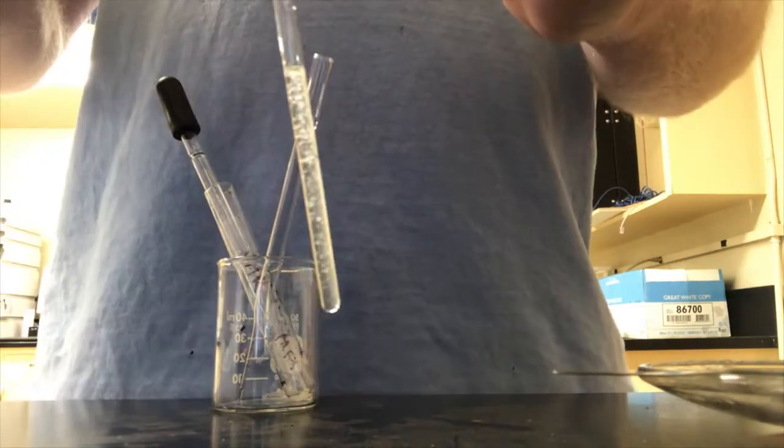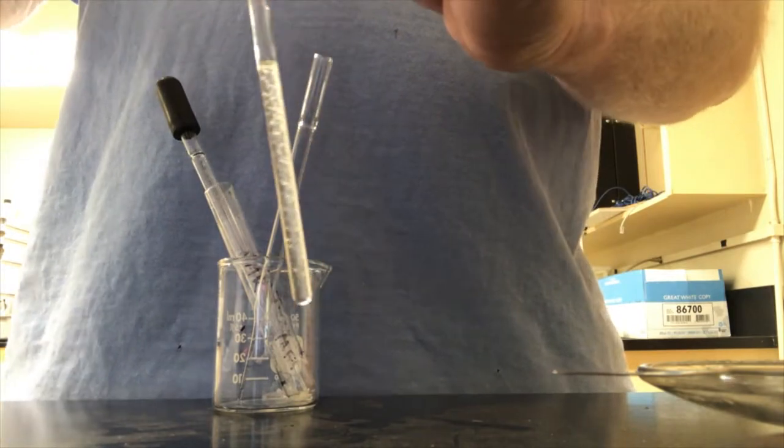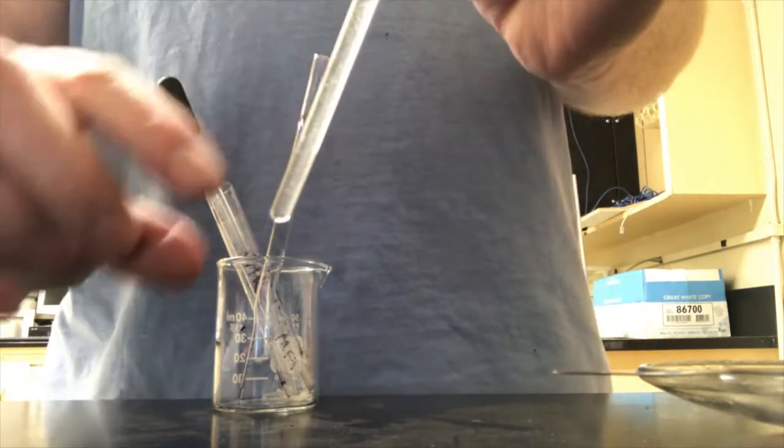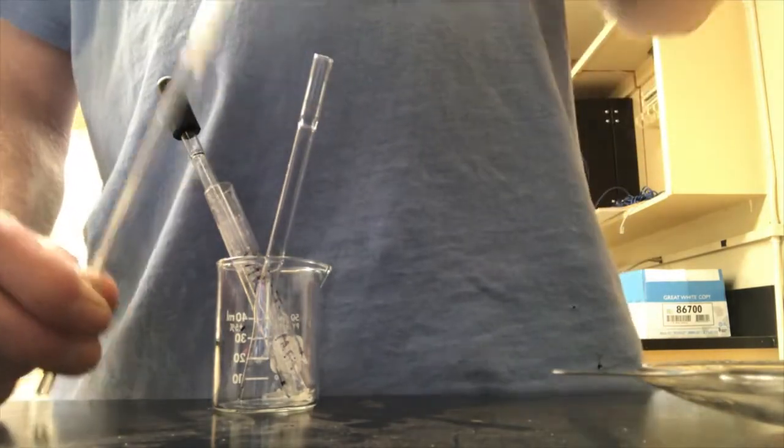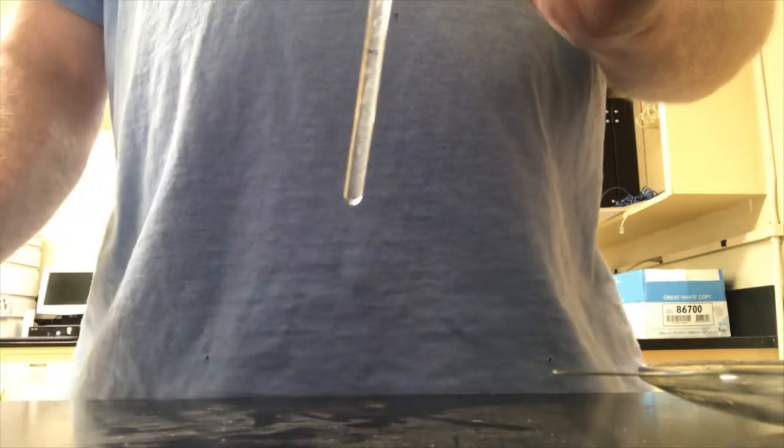And if I want to really go to the next level, I can heat this just very briefly with a blow dryer. But you have to be careful. If you heat it up too much, this cap will pop off on you. So you always got to wear your safety goggles and be careful with it. But I believe that this alone is going to be good enough. It's going to give me all my carbon signals. That's my guess.